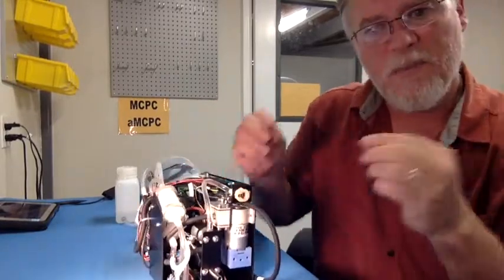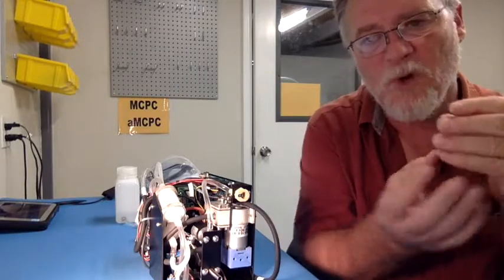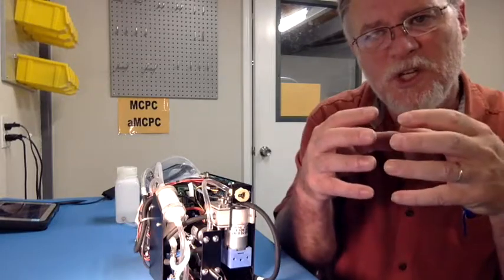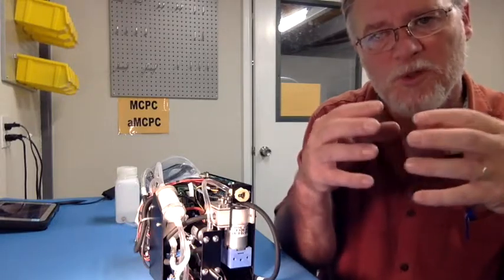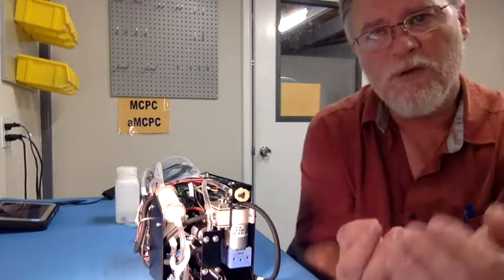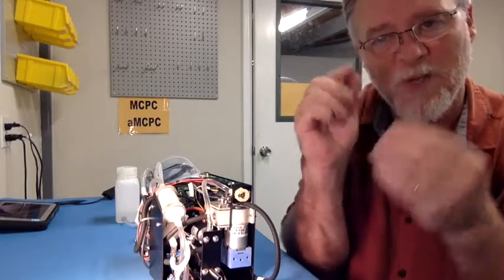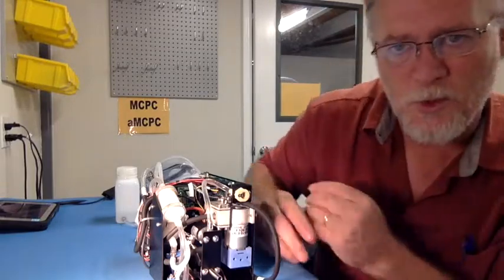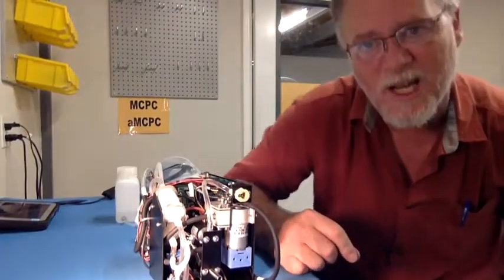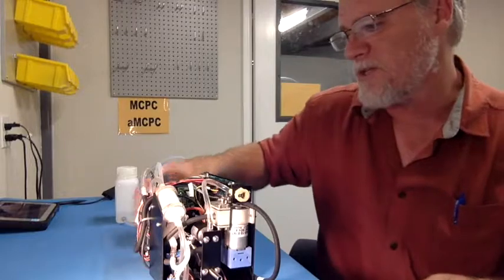And then the mixing of the sample flow and the warm saturator flow in a 20 degrees C condenser block causes condensation to happen very rapidly on the particles so that they grow up into several micron drops, and the combined flow flows up into the optics block where a laser is detecting individual droplets. We only do individual droplet detection. We do not use any kind of photometric type detection in this particular CPC.